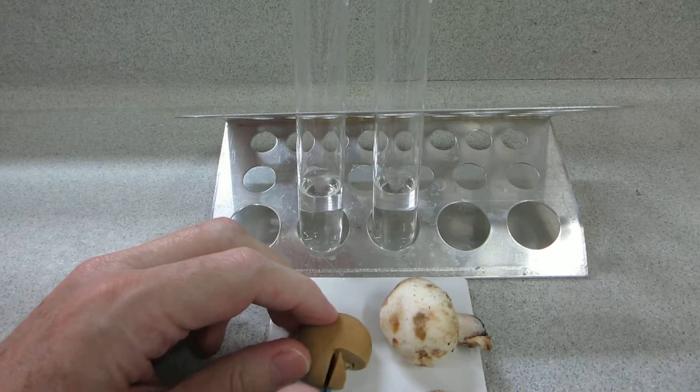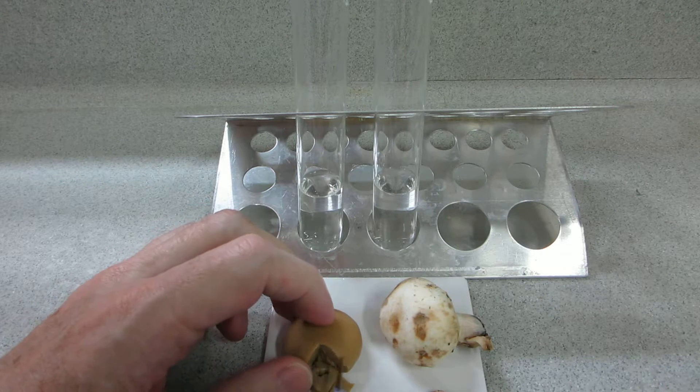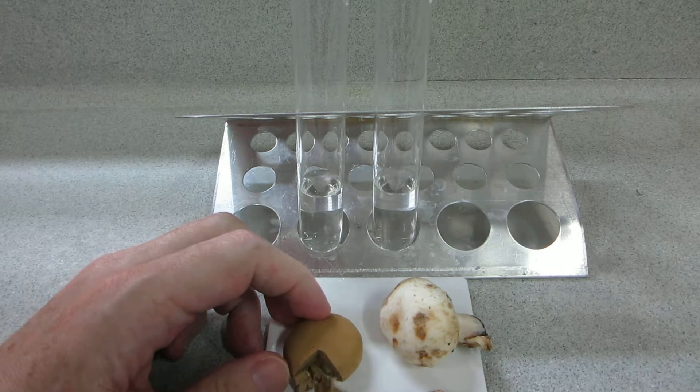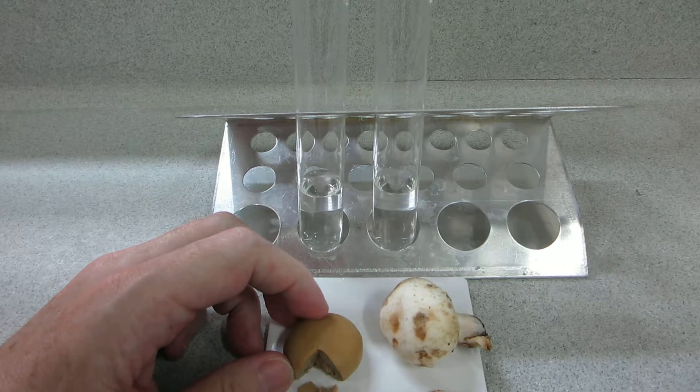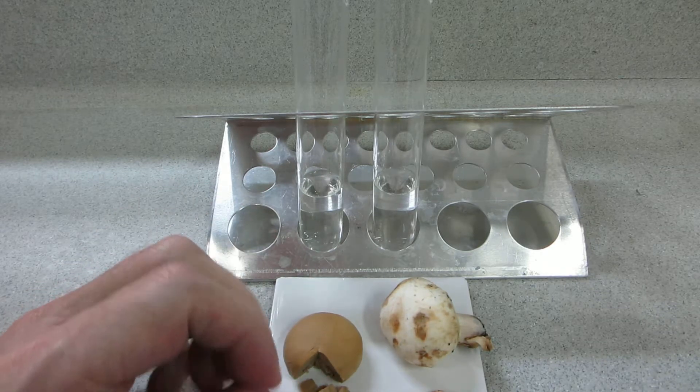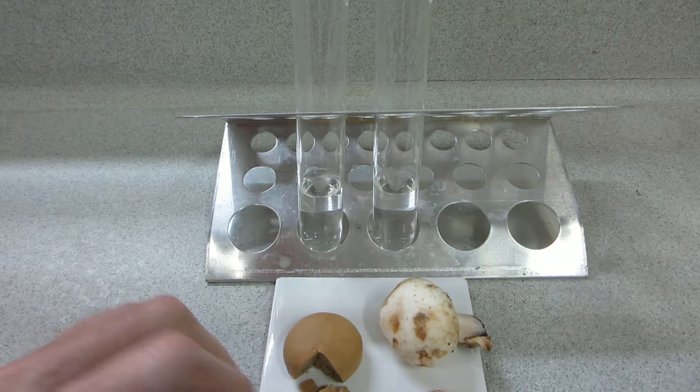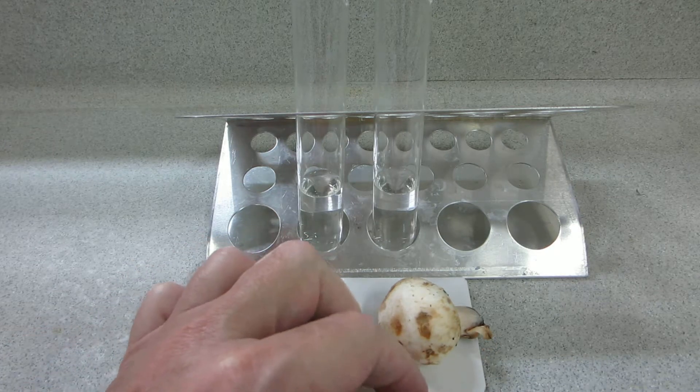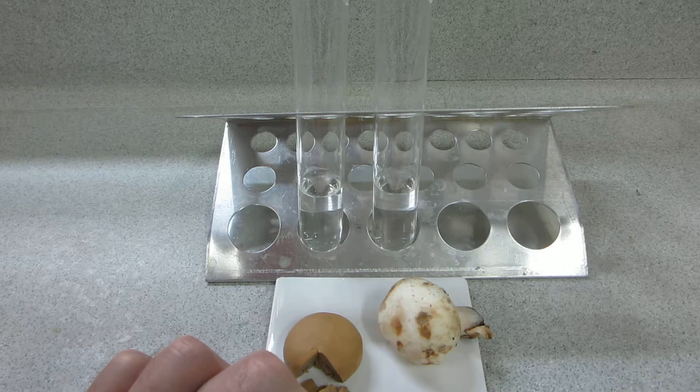If we take a little slice of that and mash it up, there's a little increase in the surface area. You can see on the right we've got an uncooked live mushroom.